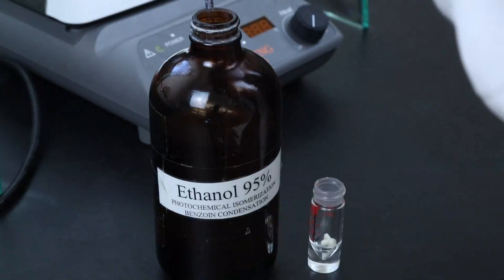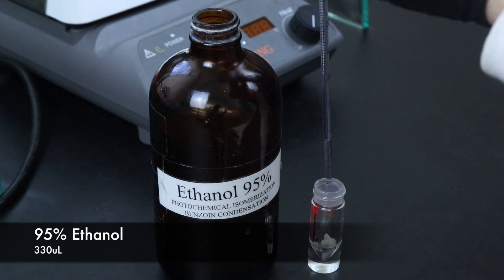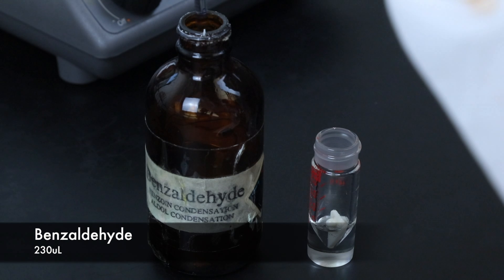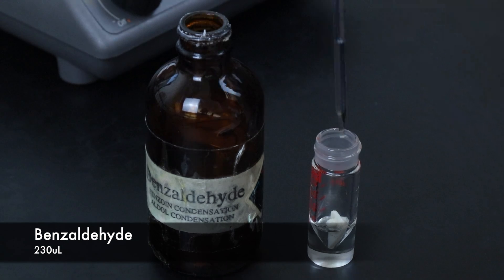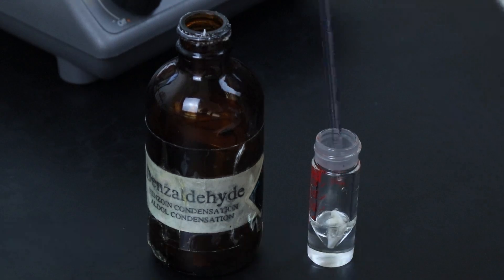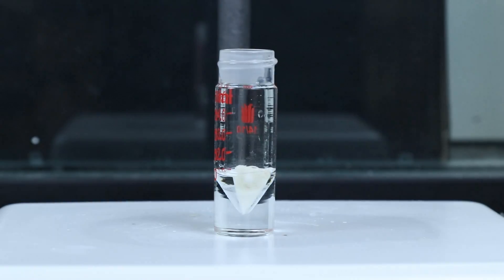From there I'll be adding 330 microliters of 95% ethanol and 230 microliters of benzaldehyde.